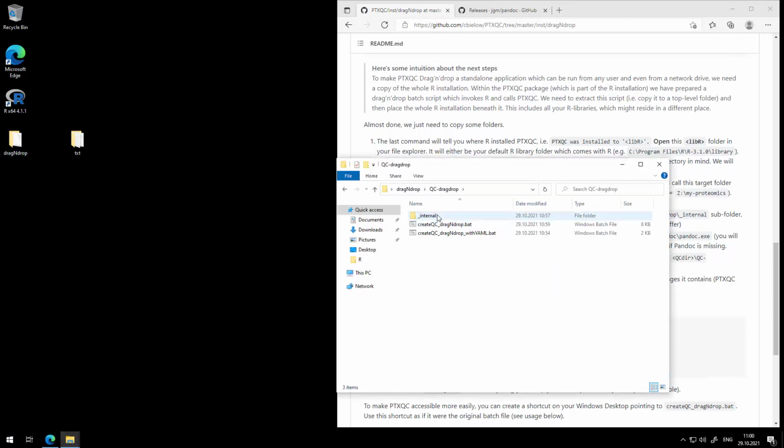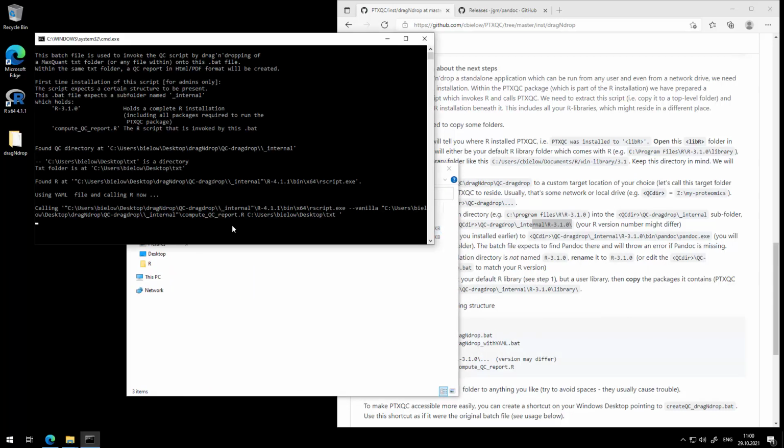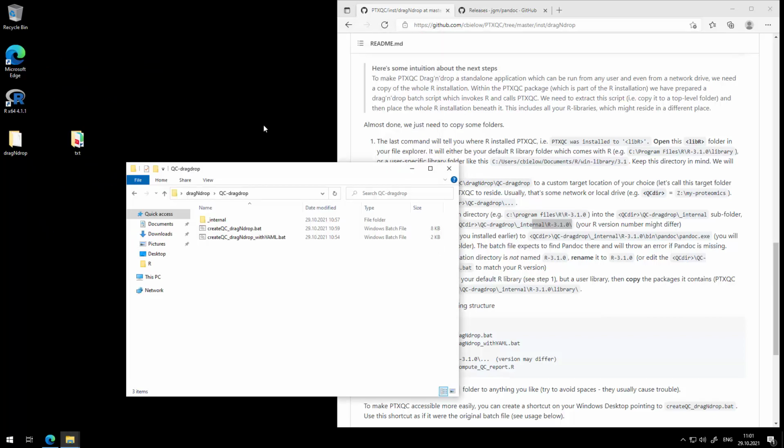So we need to drag something onto this batch file, and here I have a txt folder. I just drag it onto there, and the batch file is going to get invoked, and it's going to run PTXQC, and it will create a report and all the other auxiliary files within that txt folder.